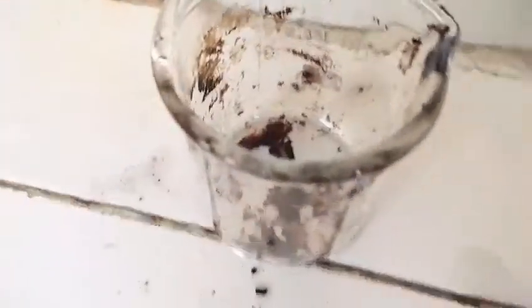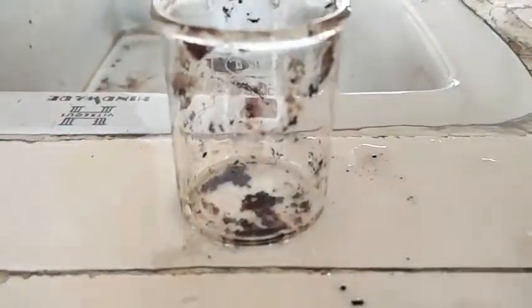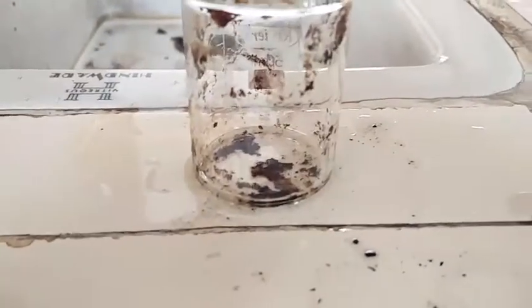I got this tiny beaker and I'm gonna put some sugar in there. A little more. And I wet the cup because this reaction is an exothermic reaction.